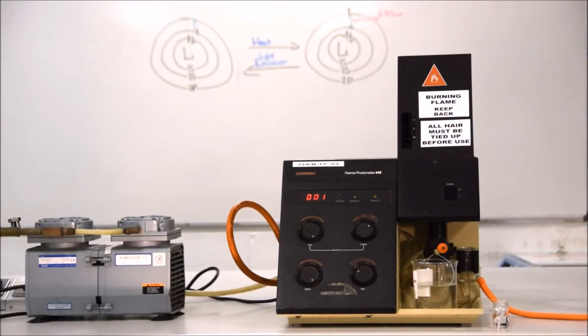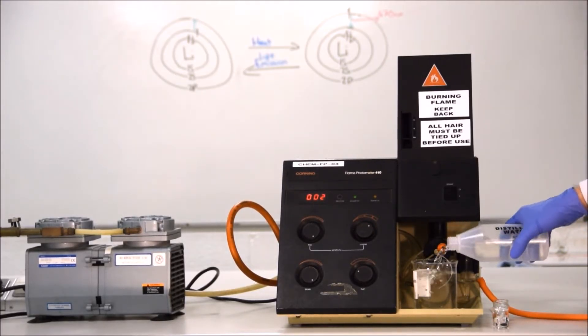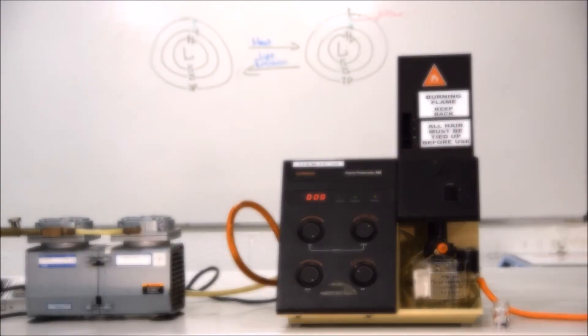It's important that there is a consistent supply of distilled water being taken into the nebuliser, so make sure you keep the beaker topped up with distilled water. It's very important not to use tap water, as it contains a large amount of sodium.